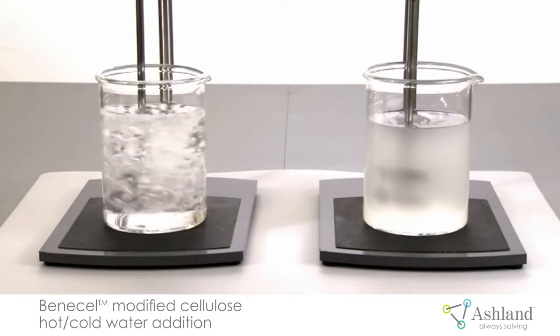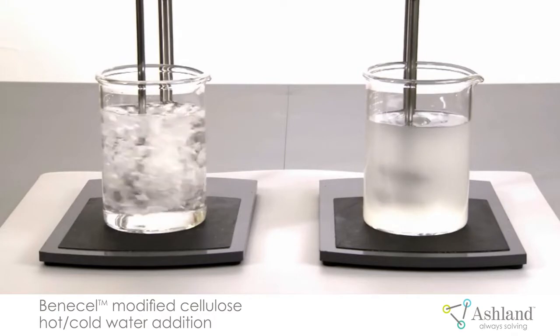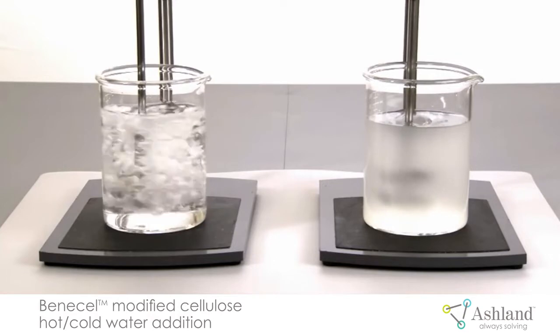The solution on the left has started to hydrate, but again it will take much longer to be fully hydrated and mixed. We are keeping the mixer speed low to prevent air entrainment.